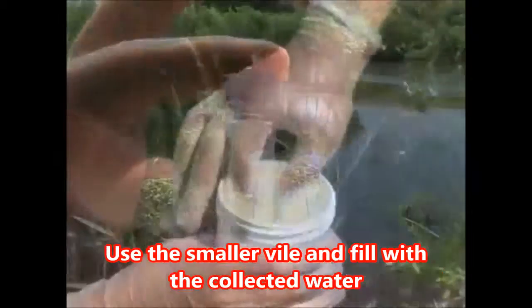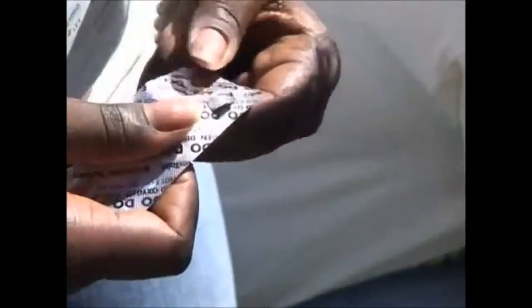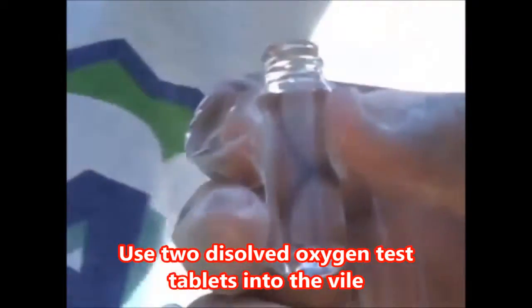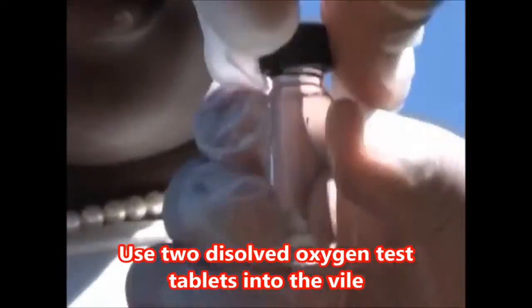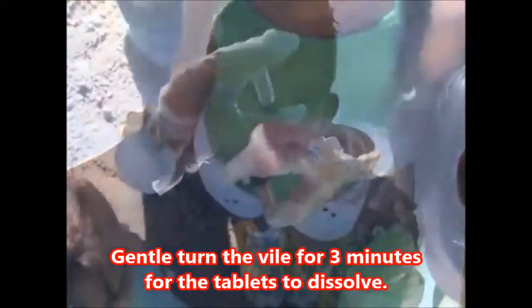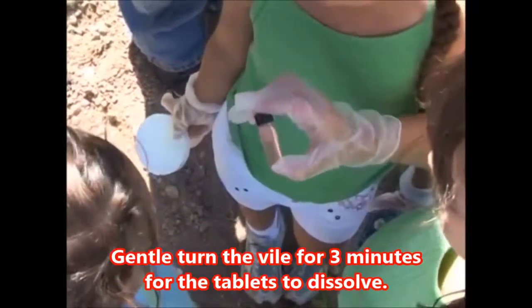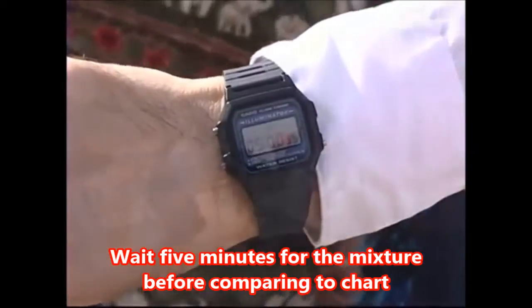Using the smaller vial, fill it with water all the way to the top so there is no air left in it. Drop 2 dissolved oxygen tablets from the blister pack marked DO into the test kit and screw on the cap. If your vial is filled properly, some water will overflow as you do this. Now gently turn the vial end to end for several minutes to dissolve the tablets. Do not shake it. Once the tablets have dissolved, wait 5 minutes for the color to develop.